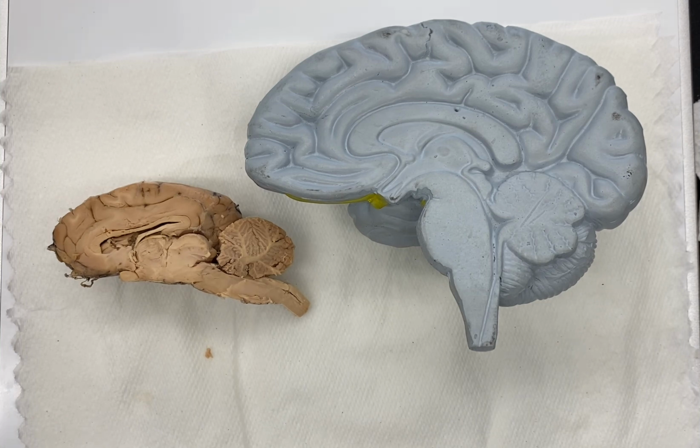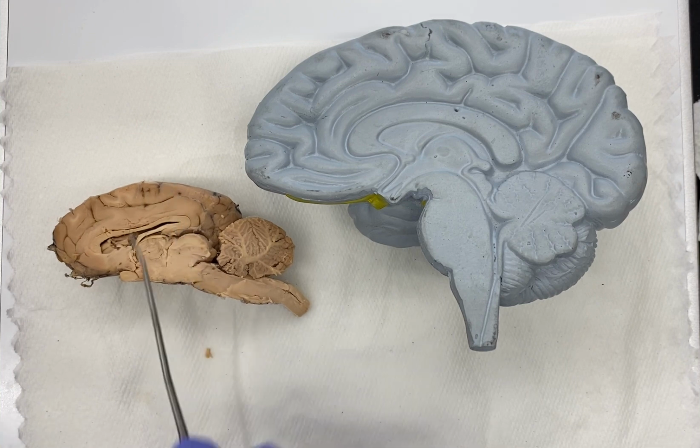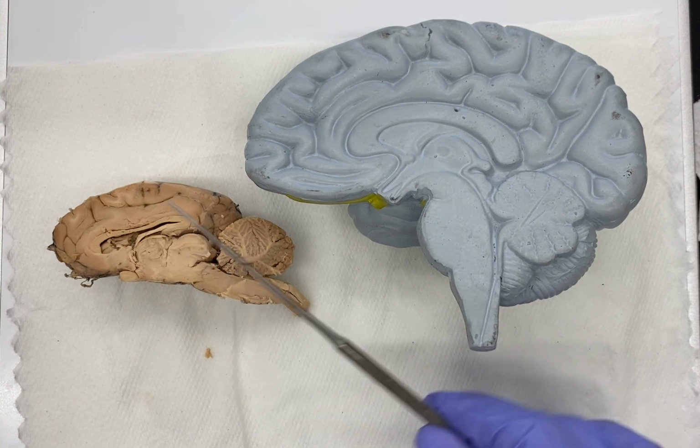Now, if you're looking carefully, you may see a difference in the brainstem and then continuing onto the spinal cord. If you see that, you're starting to see one of the main structural differences between a human brain and not just a sheep brain, but any other brain that belongs to an animal that is a quadruped, meaning it walks on 4 legs as opposed to us being able to walk on 2. And so that main difference is the orientation of the spinal cord and brainstem relative to the rest of the brain.